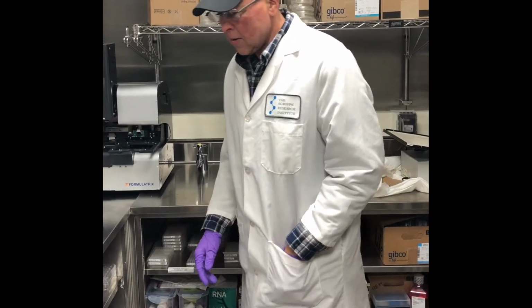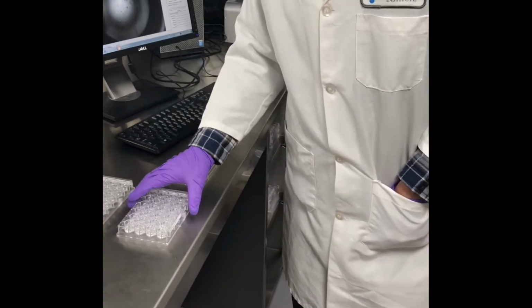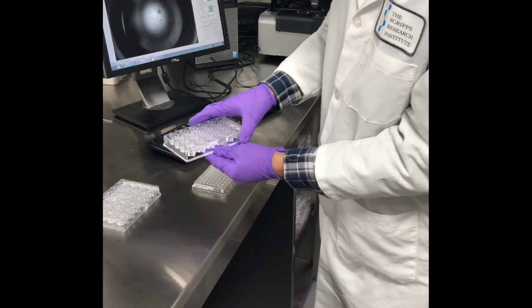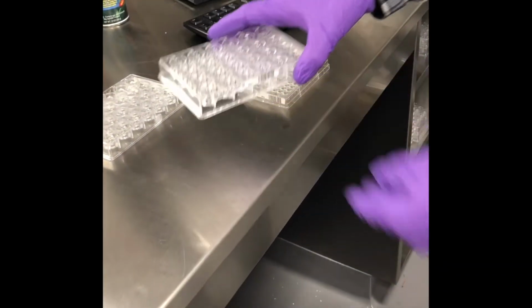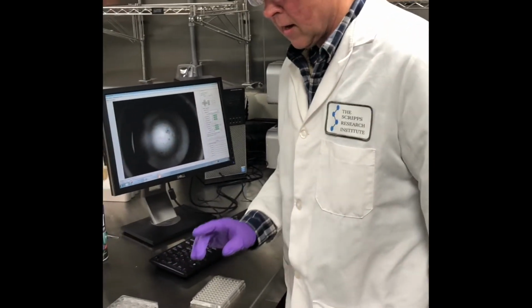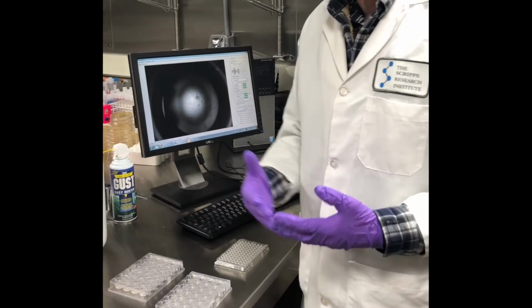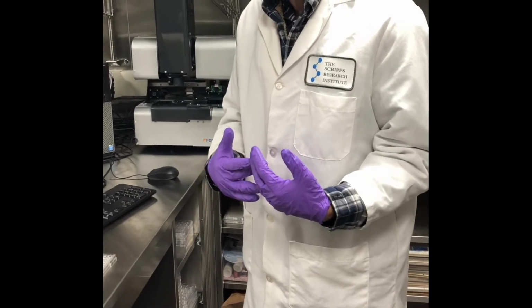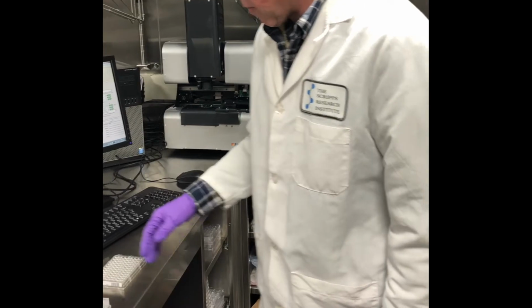Okay, next we'll see how to image a 24 well plate on the Rock Imager 1. So you can do this either with the barcode that you've printed out in Rock Maker. The barcode printer is down in IE45 in the X-ray lab. So typically most people make their experiments in that room rather than the cold room. Print your barcode labels out, bring the labels down here and put them on the plates in this room.